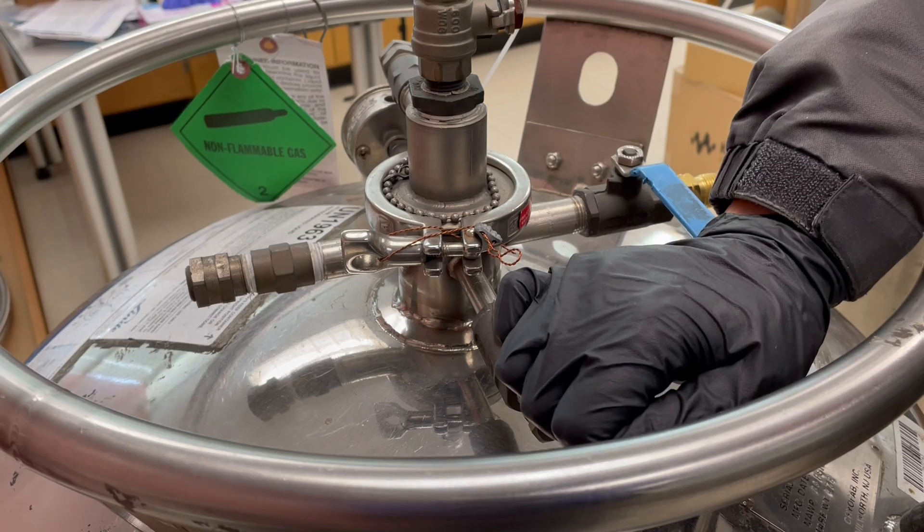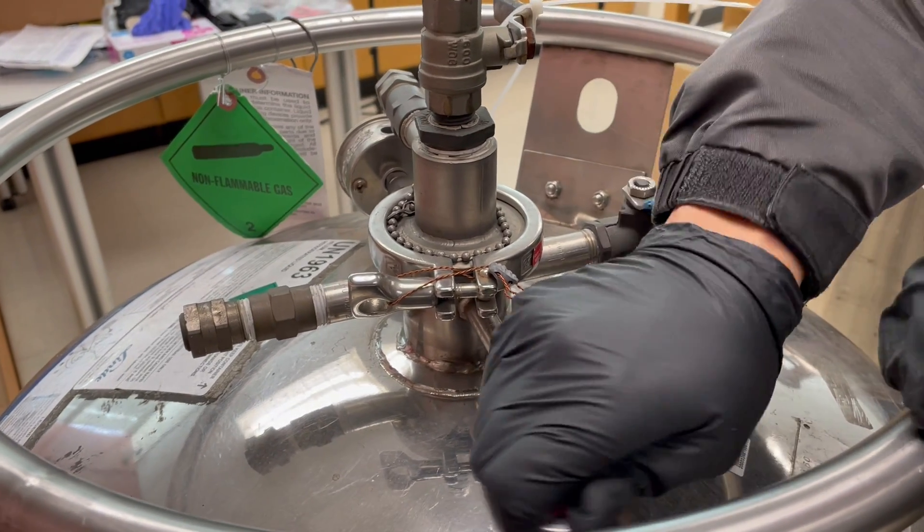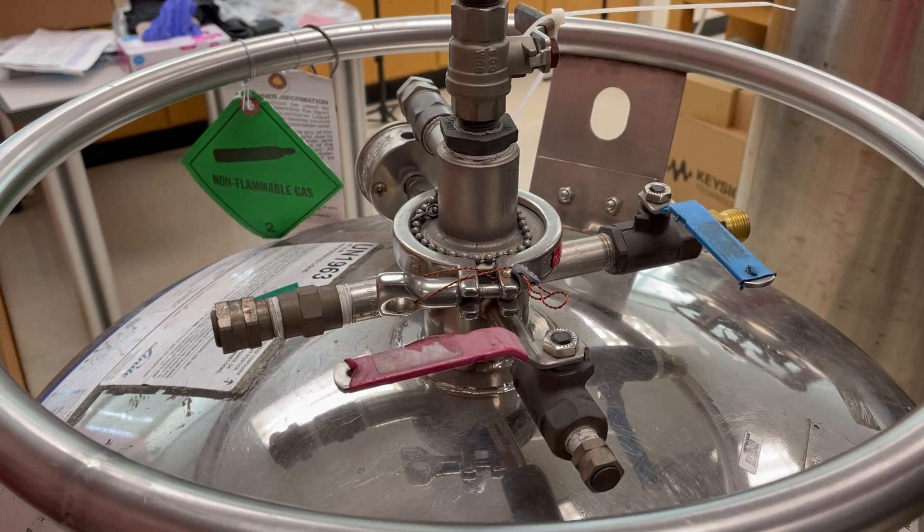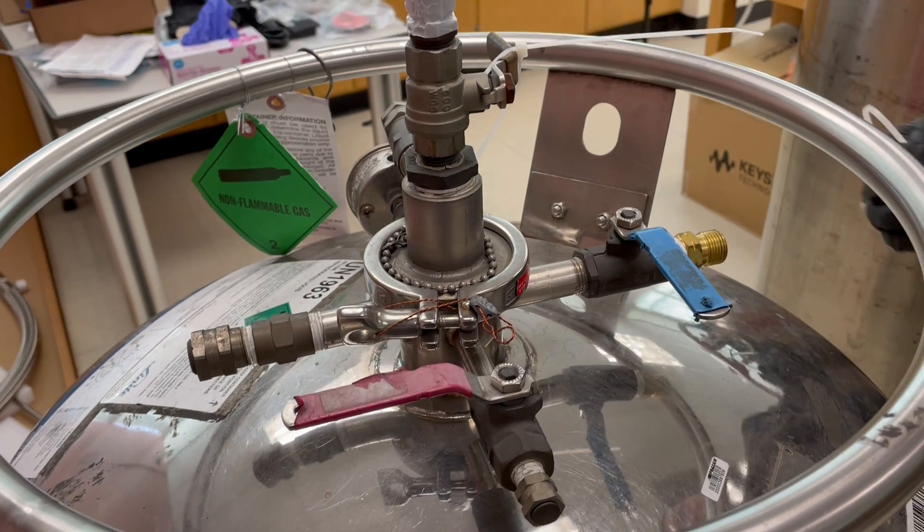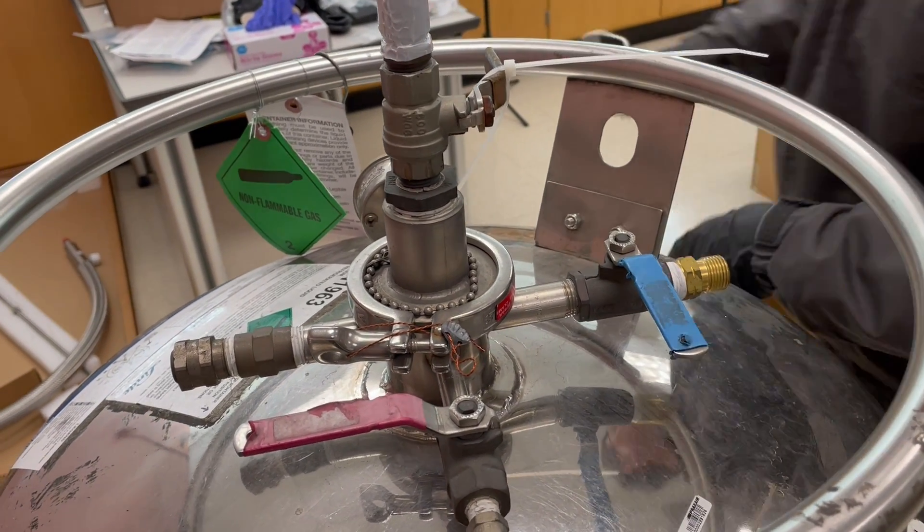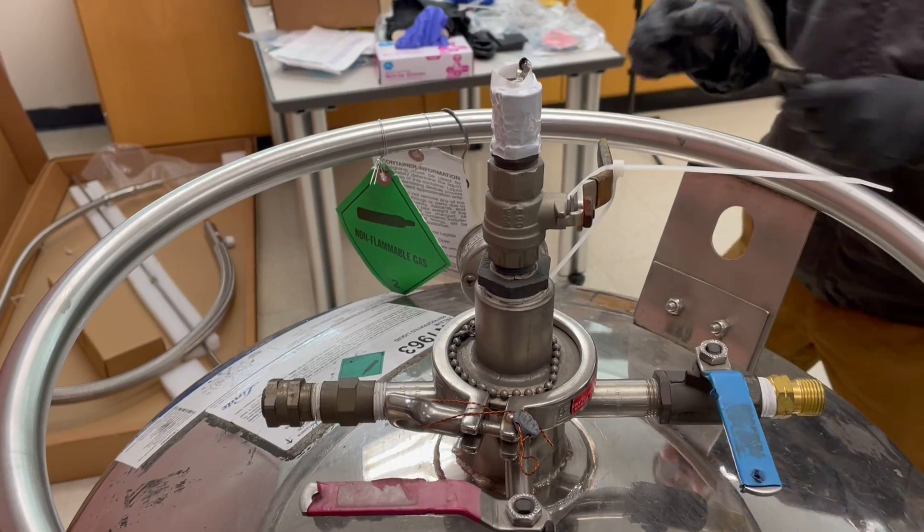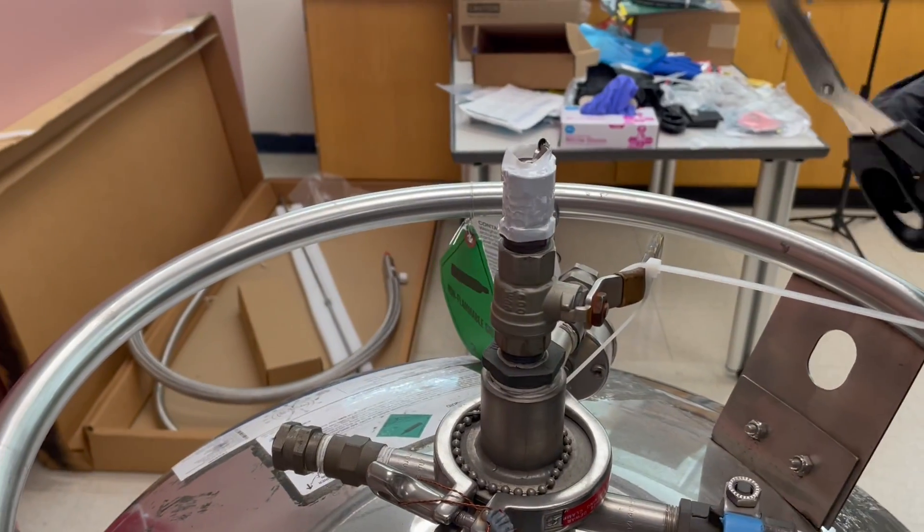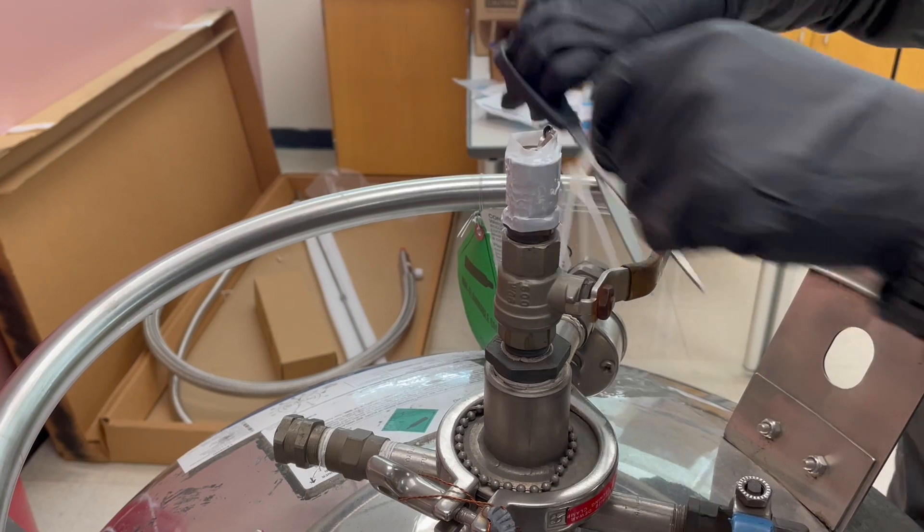But for now we are doing the experiment, of course we want to close it. Just turn clockwise. That's the first thing. Second thing is we will also open this one.